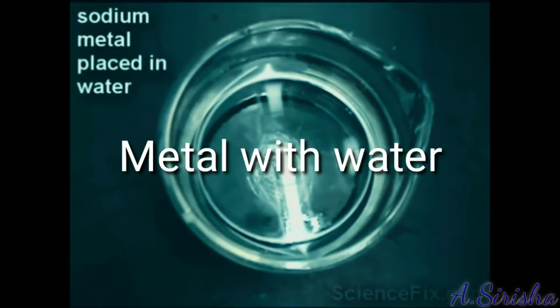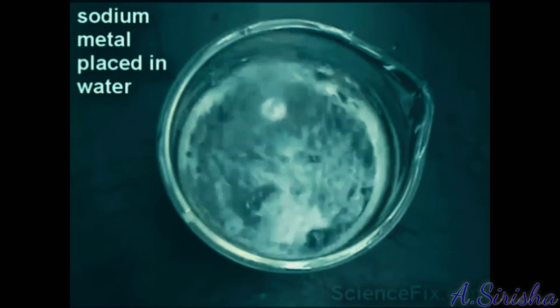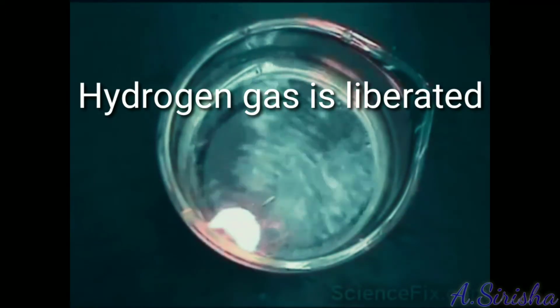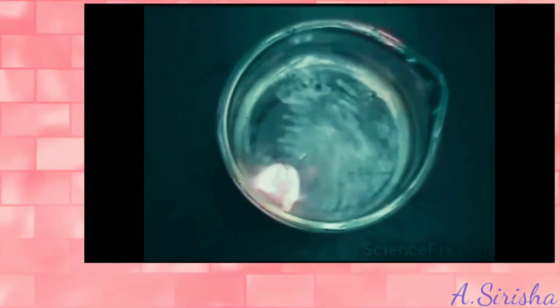Now we see the reaction of metal with water. Put a sodium piece in water. The piece of sodium floats on the surface of the water with a hissing sound. This shows that sodium reacts extremely fast with water.